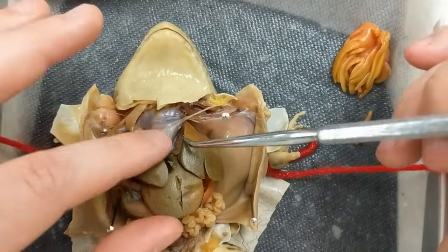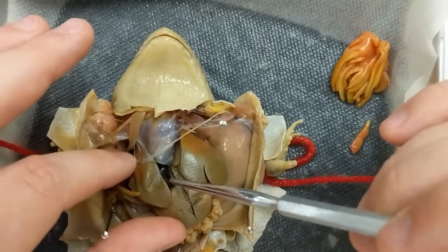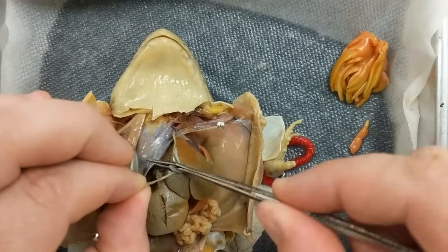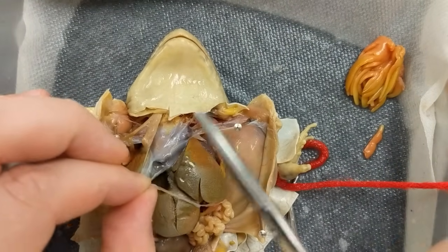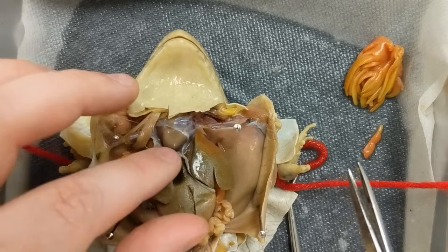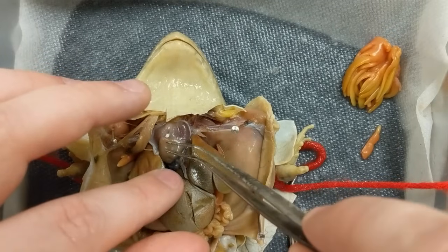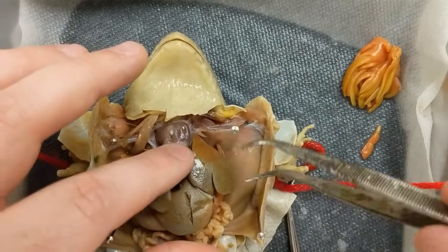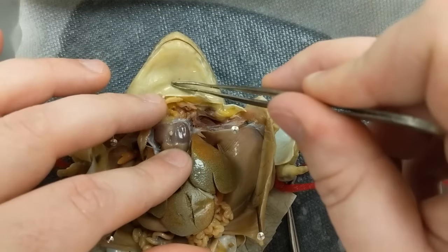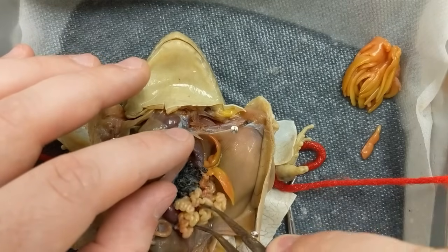You'll have the heart, which is surrounded by a nice protective membrane. You can remove some of that material around it — use your tweezers or give it a little snip to reveal it. There is the heart — it's got three chambers: two atria at the top and then the ventricle at the bottom. Right above that, if you cut high enough, you'd find the esophagus, connecting to the throat. And that is the rundown of the organs.